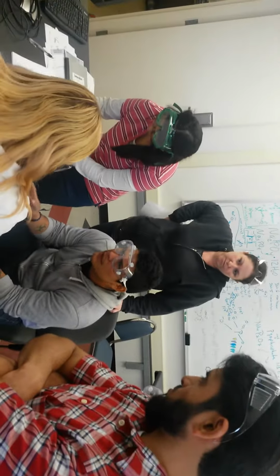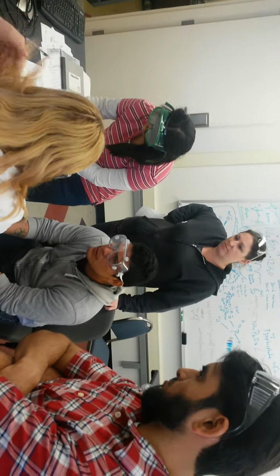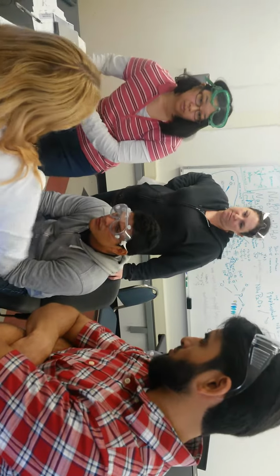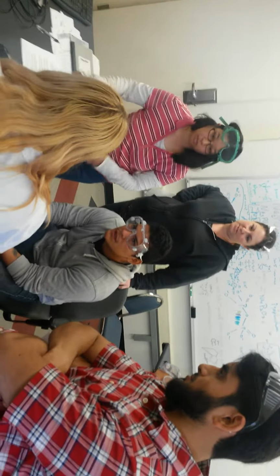By when would the data be available for sure? Well, what number are you? You were number 3, Caesar, the third one. So 45 times 3 is 135 minutes, which is 2 hours and 15 minutes. Then you can come in and pick up your data.